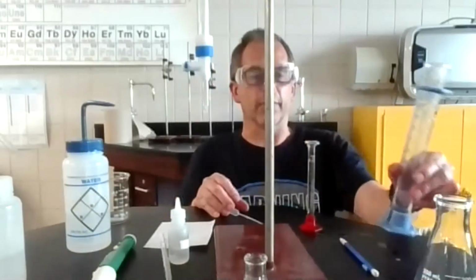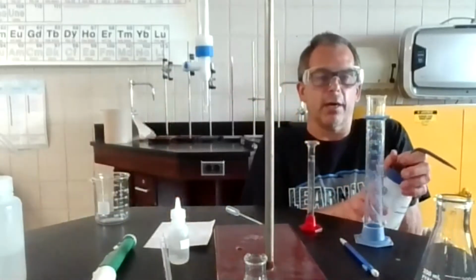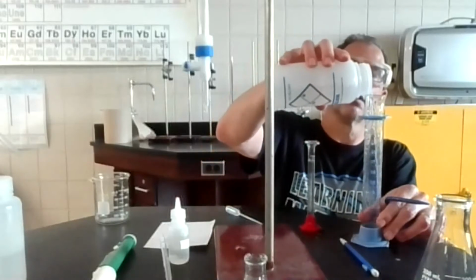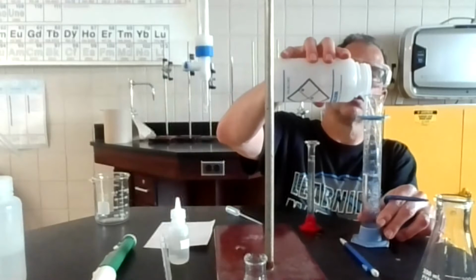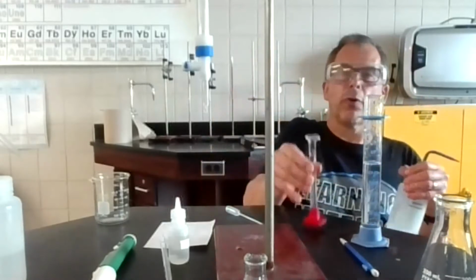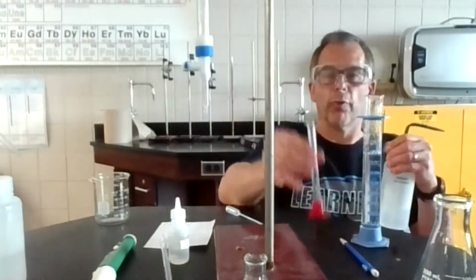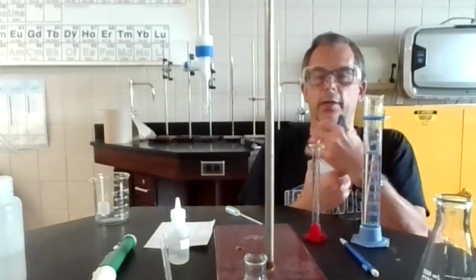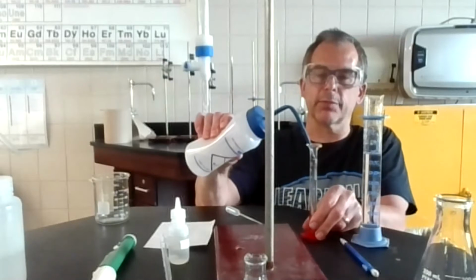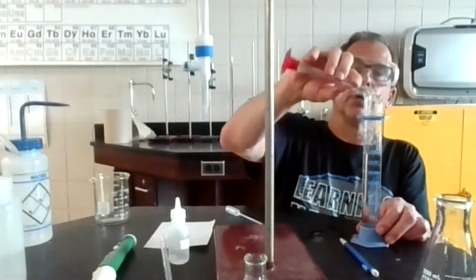Now, instead of just dumping it right in here, I'd like it to mix better. I think I'm going to put some water in here, and I think it'll be a little quicker to just pour. So I'm going to fill it halfway, 2/3, whatever. I'm going to pour this in. Now, I know there's a lot of base still sitting in this red one right here. So what am I going to do? I'm going to put some water in here. I might just fill it up to the top. Looks like it's pretty easy to do with this squirt device.